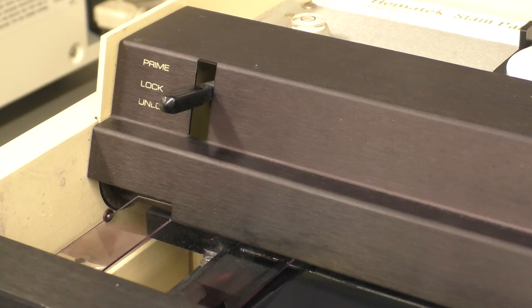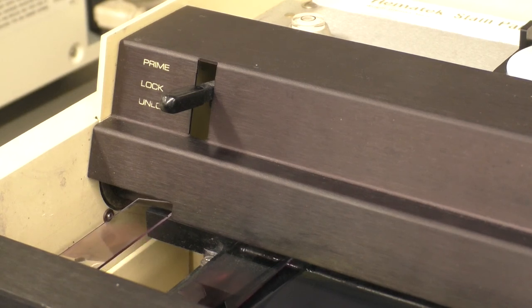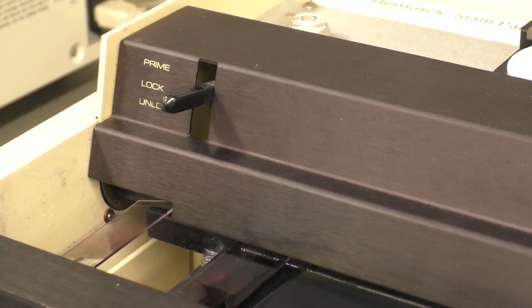After drying, the slides are gently delivered into the slide drawer and are ready for examination.